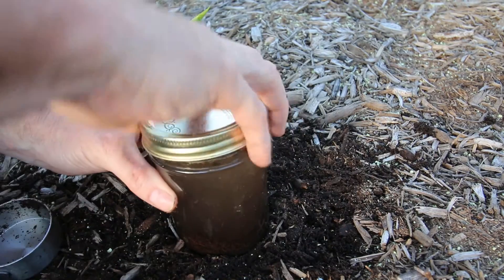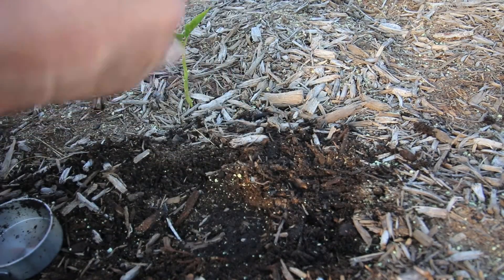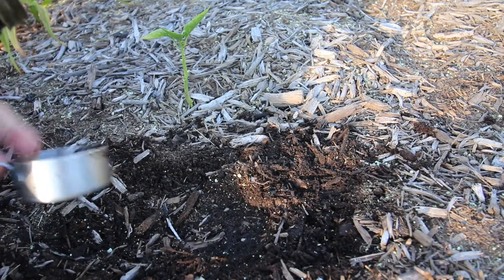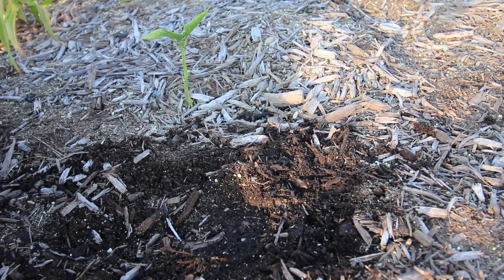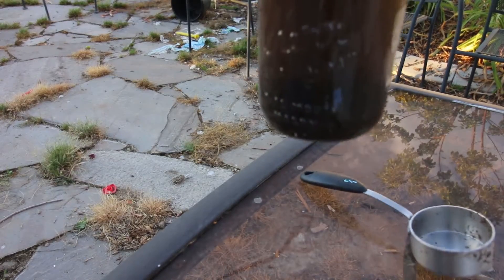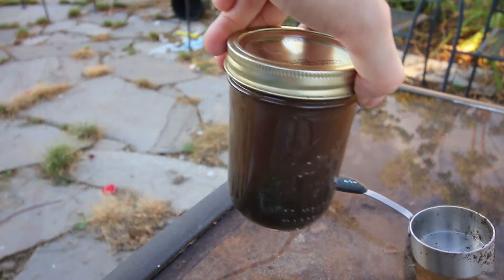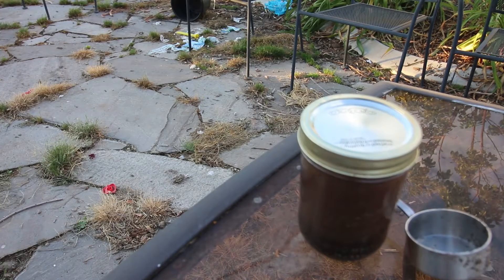It says try not to touch it. Mix it for one minute. You're supposed to let it stand so it clears, but it's not really going to matter — after one minute we should be able to do a test. Here's what we collected earlier. It's kind of murky, but it'll be okay for what we're doing.